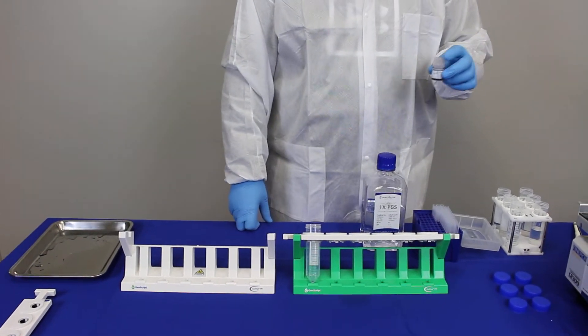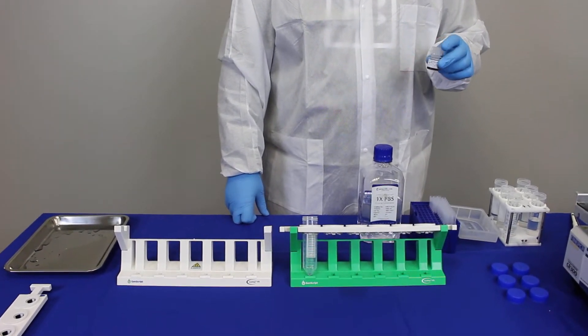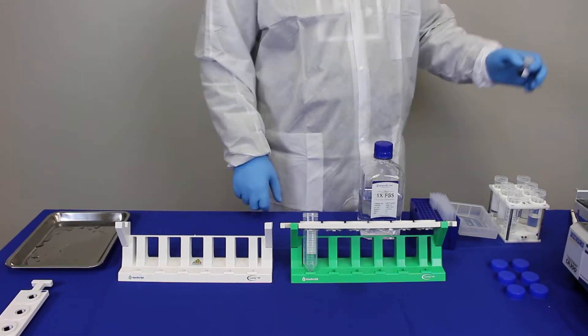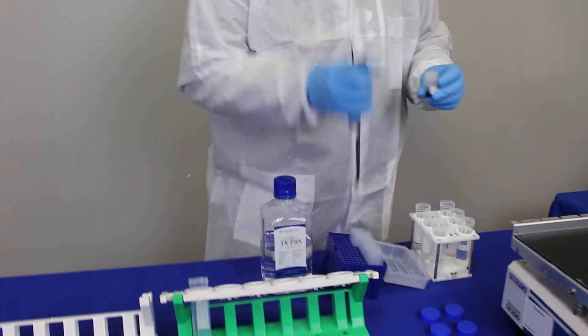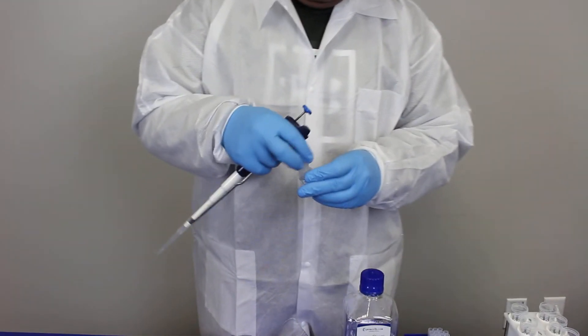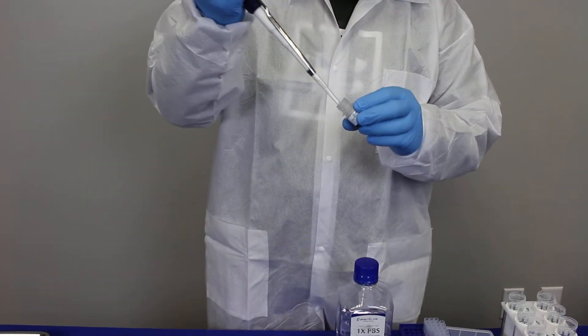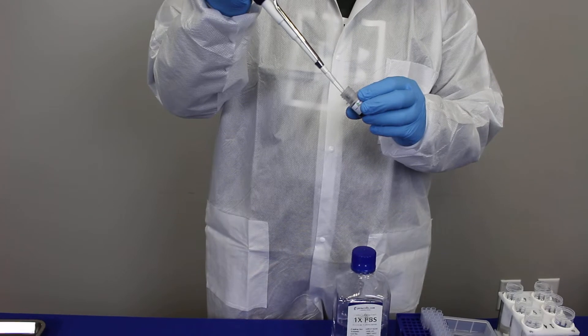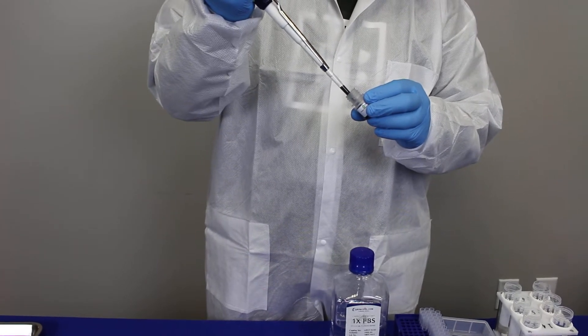Our magnetic beads come as 25% slurry, and you can just take these beads and make sure that they are resuspended well.